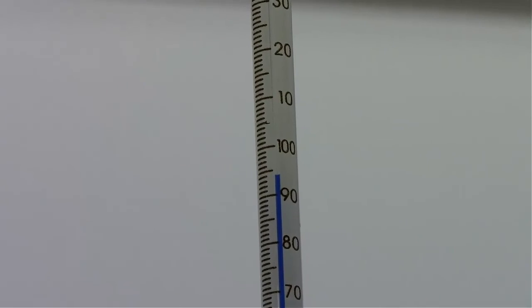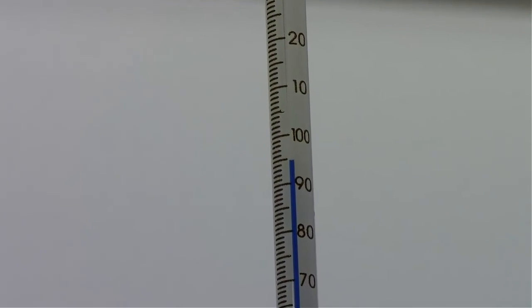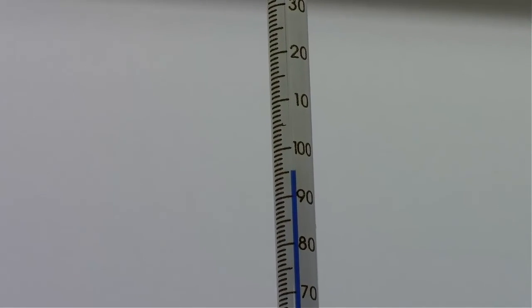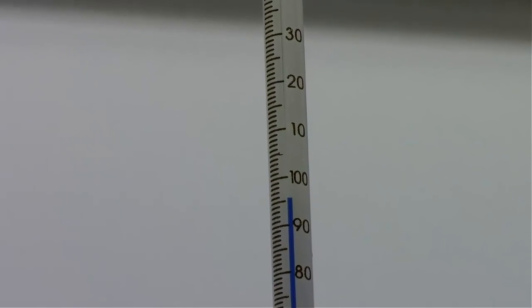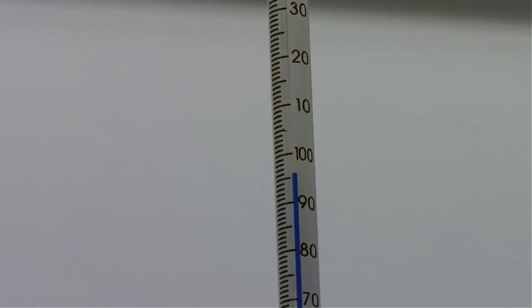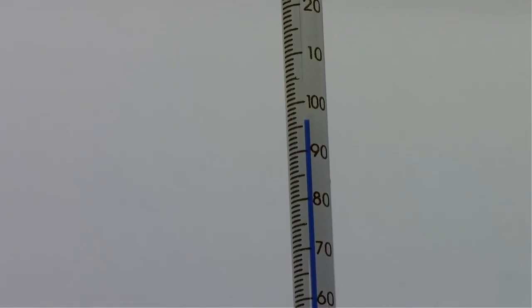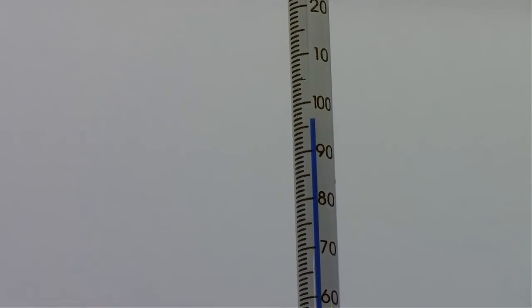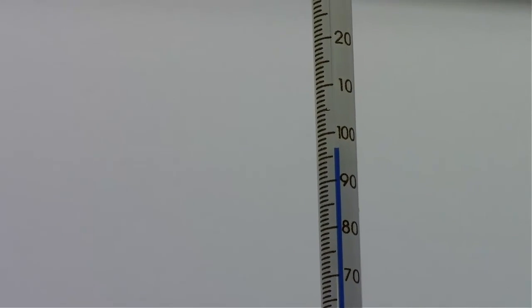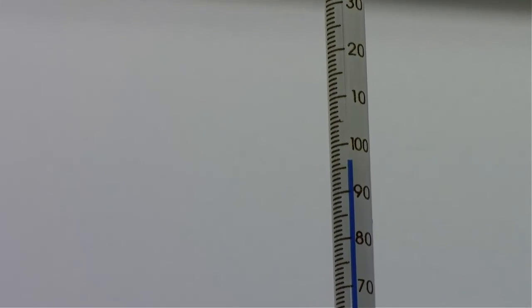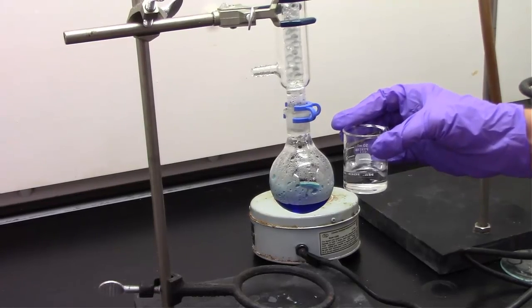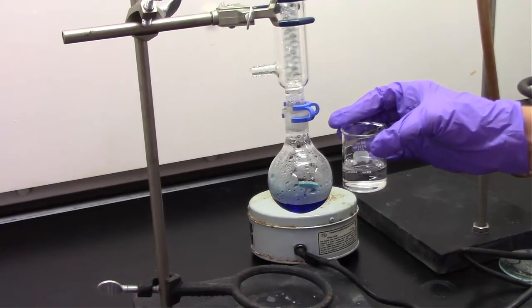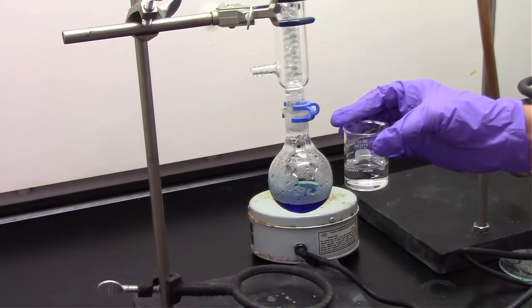And then, taking a look back at the thermometer, at this point now the temperature is starting to rise significantly. We're almost at 100 degrees. I took out a little video clip there so we didn't have to watch it slowly rise, which means that at this point we have mostly water fully surrounding the head of the thermometer. So, any further drops, the vast majority of what's in that drop would be water rather than acetone.